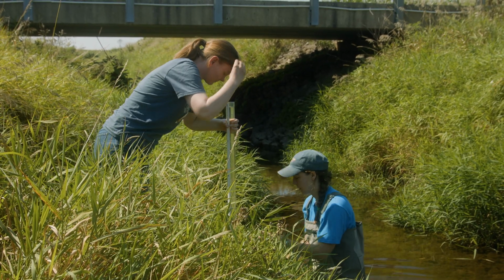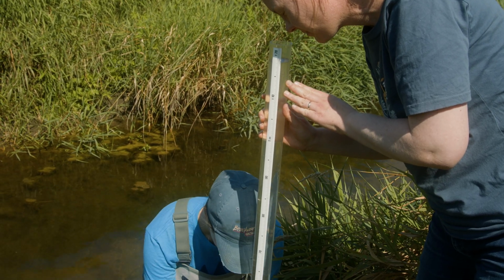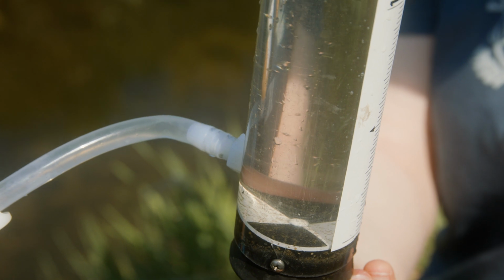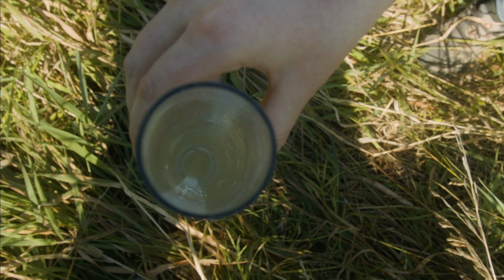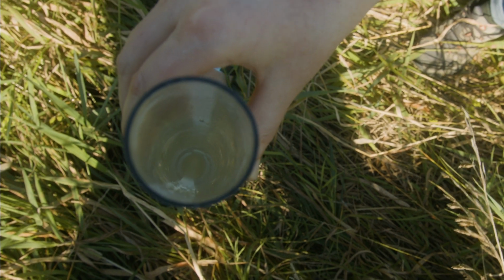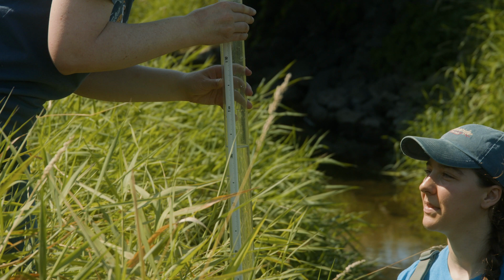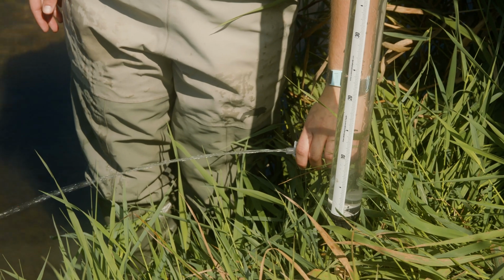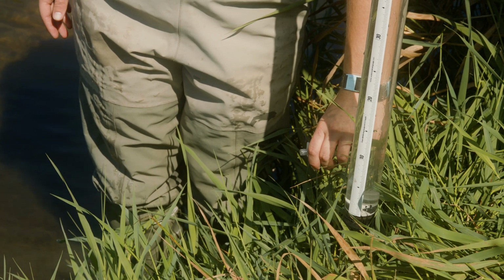If you are working with a partner, bring the tube to the shore and have your partner look straight down into the tube. At the bottom of the tube, there is a black and white target with an X. If your partner can see the X when the tube is full, record 120 on the data sheet for transparency. If your partner cannot see the black and white X, open the crimp at the bottom of the tube to slowly release the water until the X is visible. As soon as you see the X, tighten the crimp to stop the water flow.